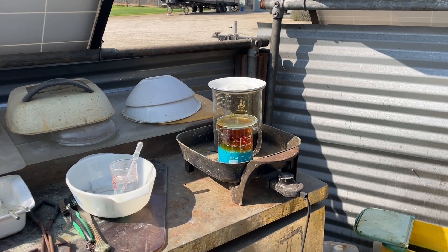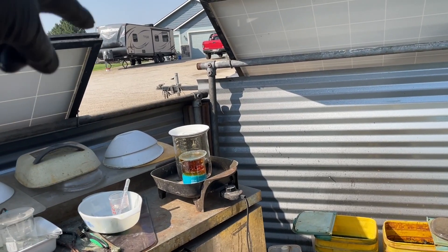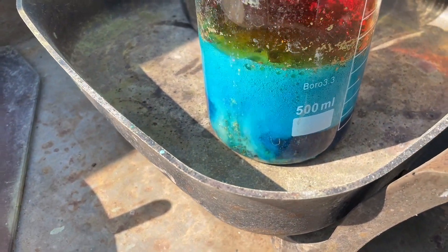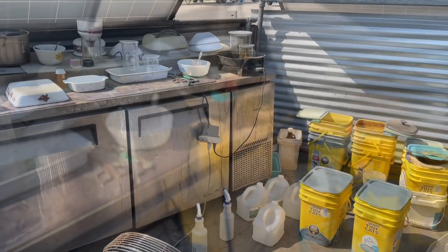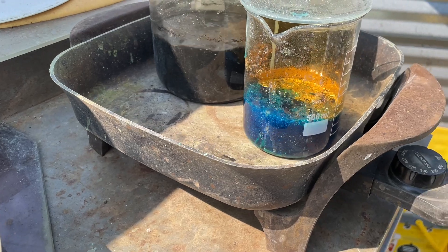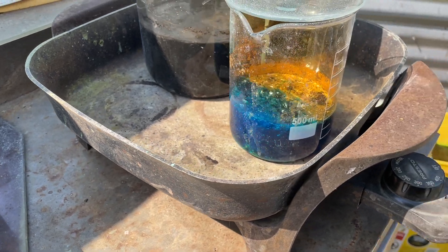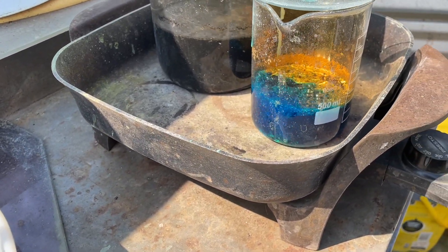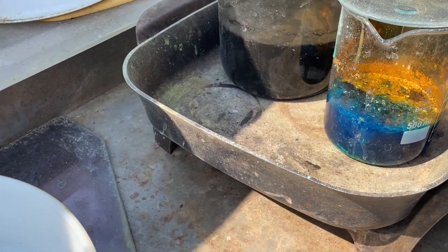The fumes get a lot darker. Oh yeah — the danger. Never breathe that stuff. I got my fan exactly blowing right there. It swirls them and they go off through there. If you can see — you can see those pins getting real light there, jumping around and kind of climbing up the side a little bit. A couple tiny tiny pieces still fighting the program. I think I'm gonna call it right there and not add any more nitric, because it probably has a little bit of active nitric in there still. Yeah there's a little bit of fumes — not much, almost nothing. And almost no pins.